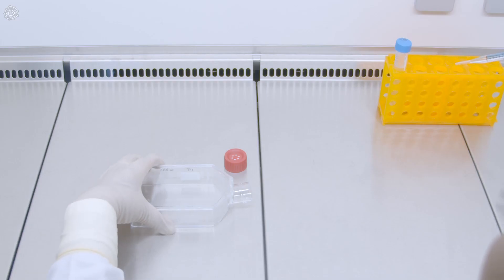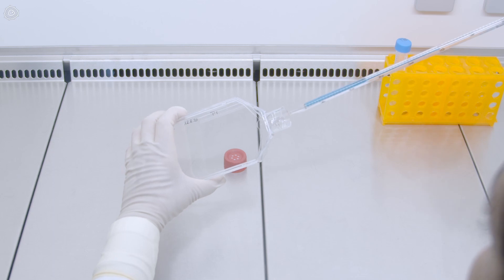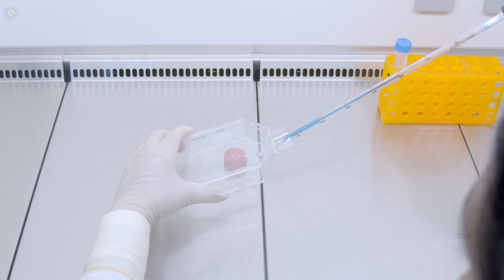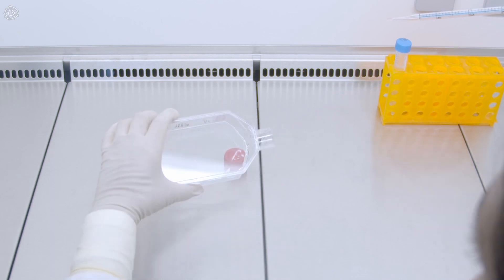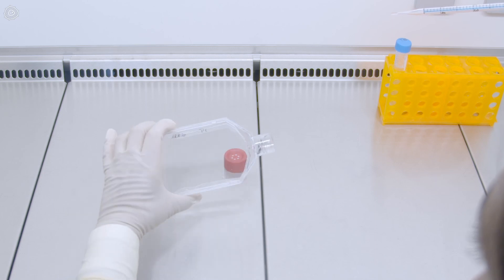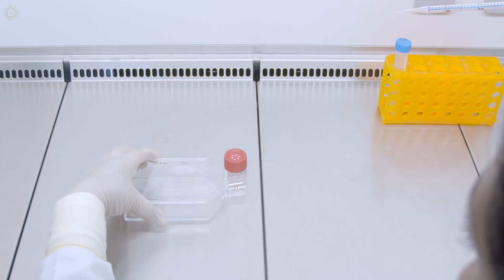Today, we will talk about passaging cells. Passaging cells is an exciting point in time for us, because unless you reseed your cells for subculturing or freeze them, this is the time point where your cells enter an experiment.